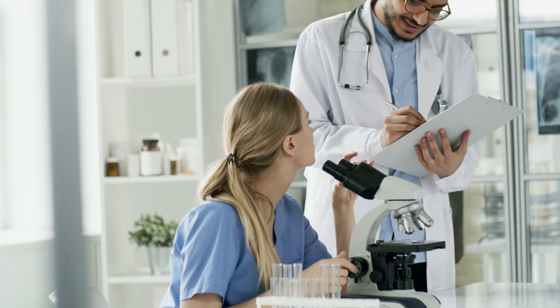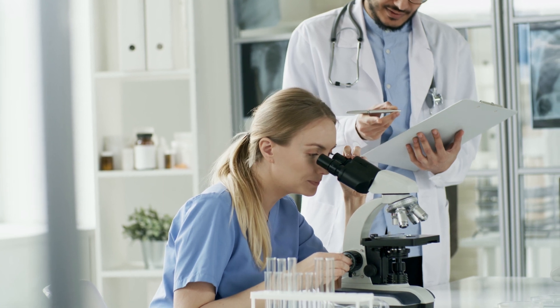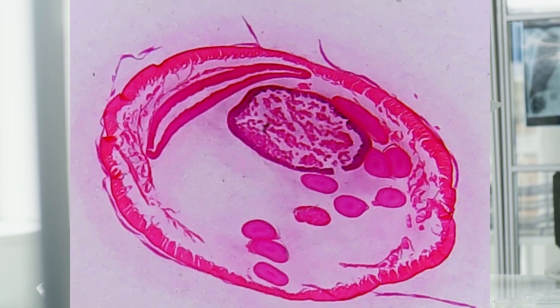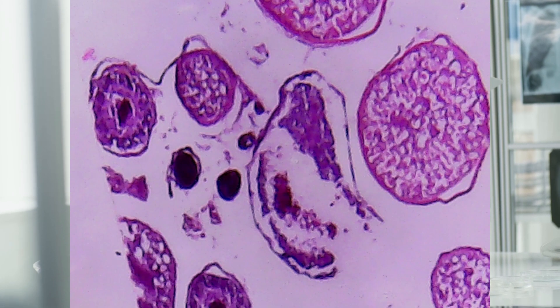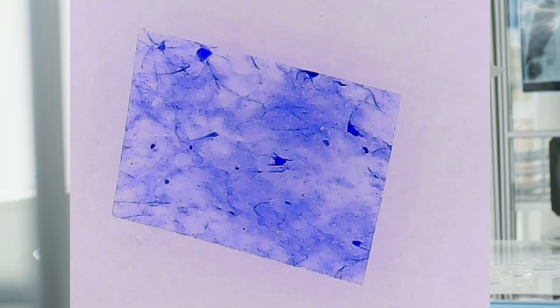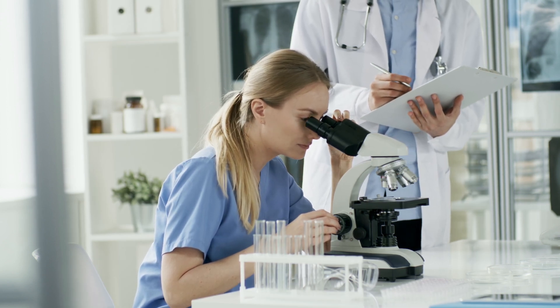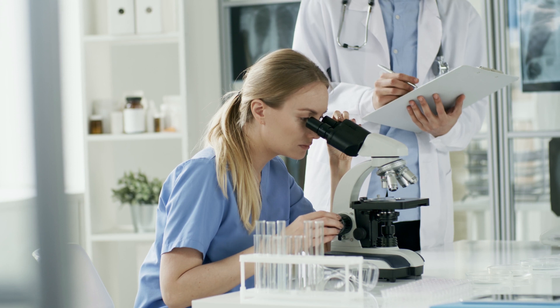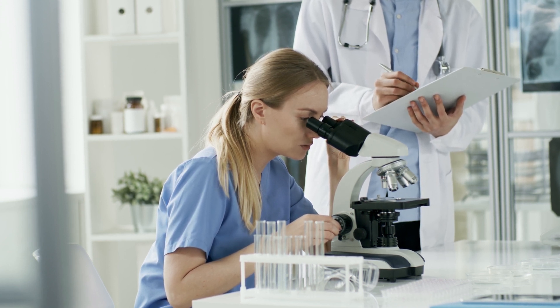Hello and welcome to this video on the different stains used in histology and what they do, although it might be more accurate to say histopathology rather than histology. If you've ever purchased a slide set that contains any kind of tissue from an animal or human, you will likely see they come in a range of colours. Some of these will be just the colours of the sections cut, while others are stained to accentuate the slide and features of interest. This is effectively the role of histology — to study the microscopic structures using various supporting agents, most often a stain.